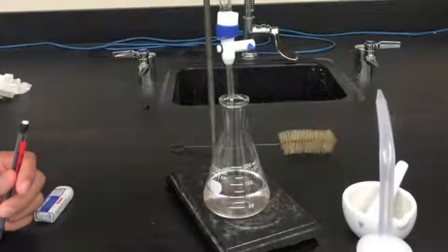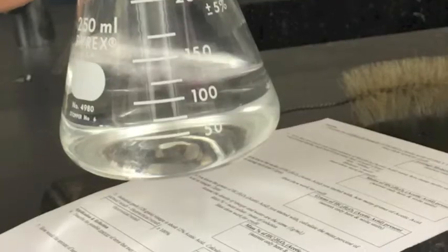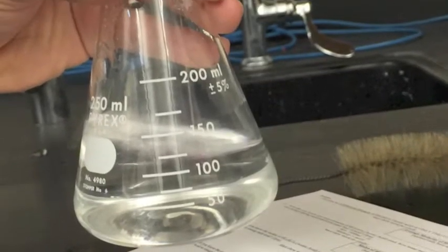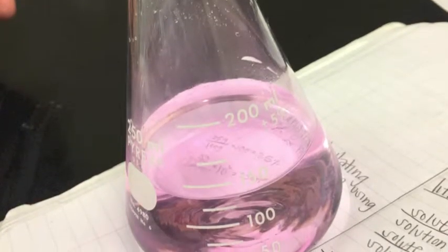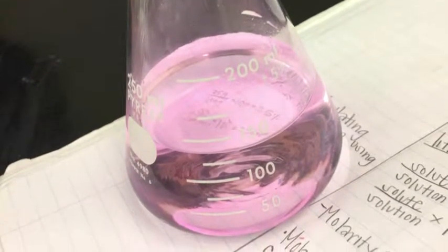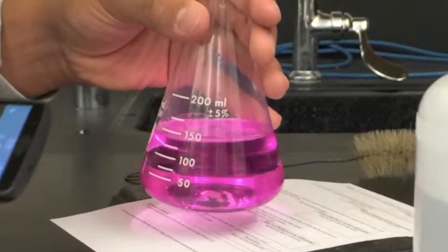It was neutralized by adding the base, sodium hydroxide, to the acetic acid, vinegar, then adding 2 drops of an indicator in order to balance the solution. We could determine when it was done neutralizing by the color change that resulted in a permanent pale pink. However, if too much base was added, the solution resulted in various darker shades of pink than expected.